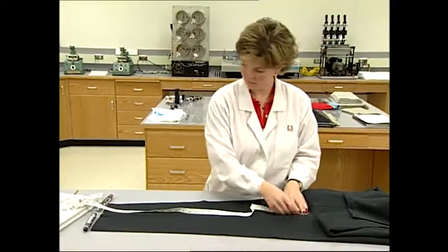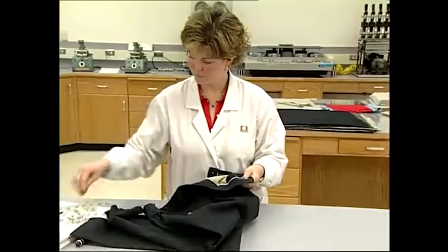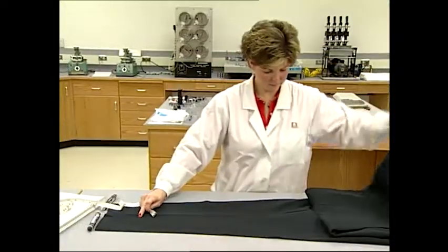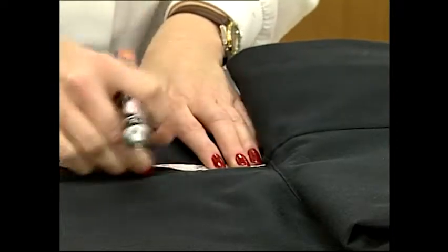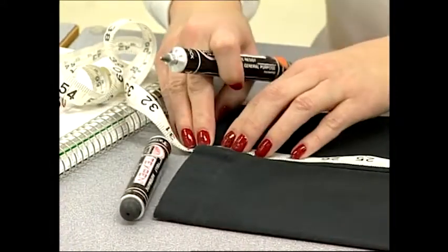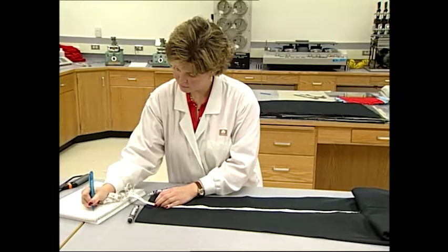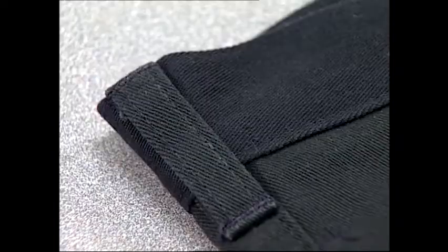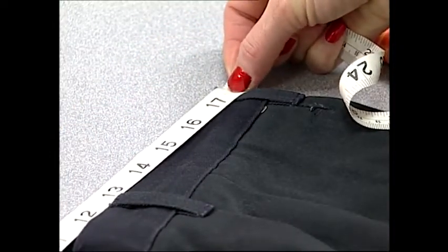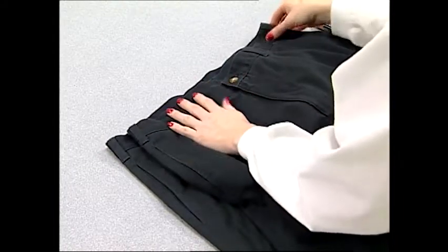Slacks or pants are measured in a different manner. The most common method is to get a length value from measuring the change in the inseam length, while width shrinkage is determined by measuring the waistband. For the length, the pants are spread on the table without distorting the garment, a mark is made at the top of the inseam where the pant leg joins the crotch, and the length is measured from this point down to the bottom of the inseam. Another technique is to make 18-inch benchmarks down either pant leg on both the front and the back. The waistband is measured for width by carefully spreading it to eliminate folds and placing a tape measure from one edge to the other. After laundering, all benchmarks are measured again and shrinkage values are calculated using the same method as with the shirts.